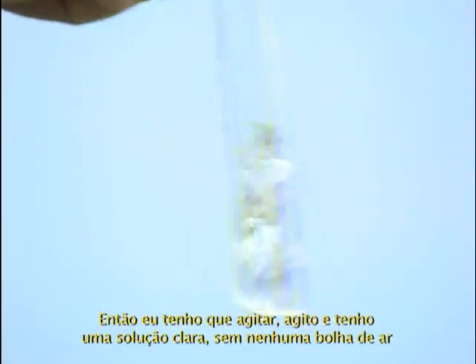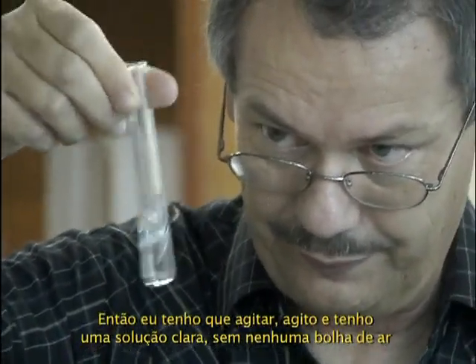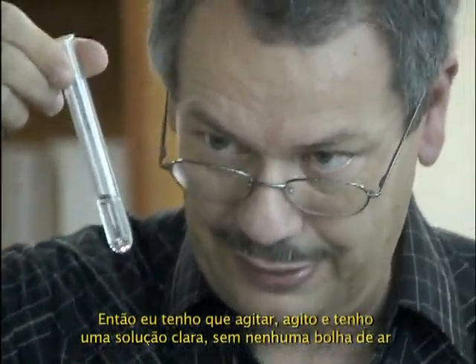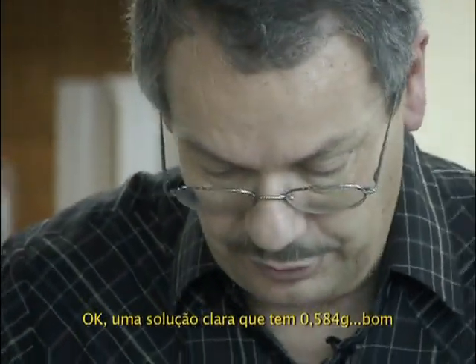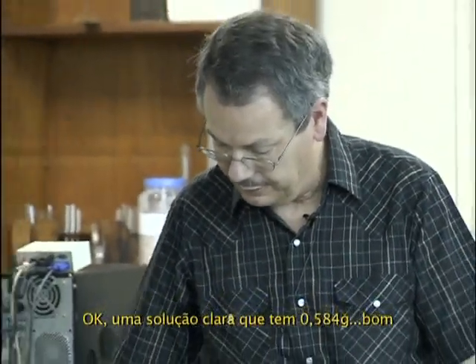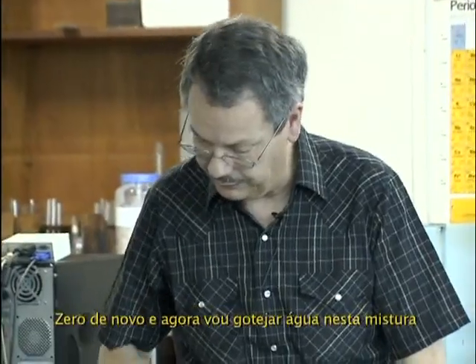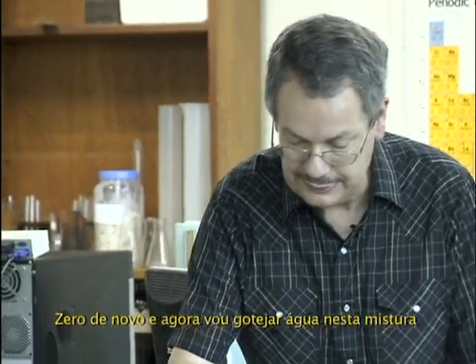I shake, and I get a clear solution without any bubbles. Okay, clear solution, which is 0.584. Good.